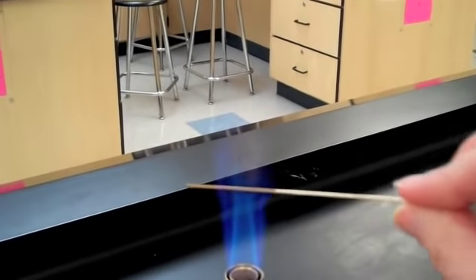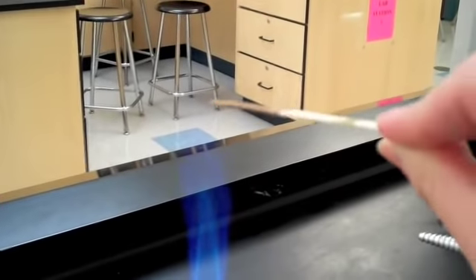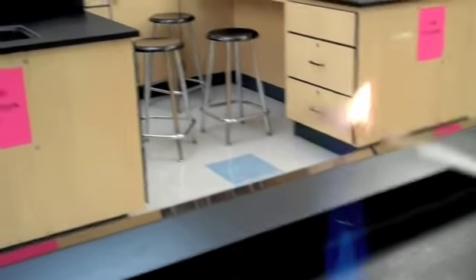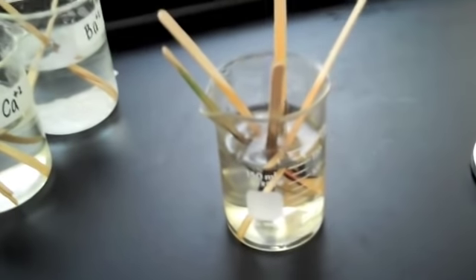The color of the iron is a little bit hard to observe, but if you look at the edge of the flame, you should see that there is an orange color coming off of our iron sample. There it is nicely. Again, we extinguish our flame that may have formed on our stick before continuing on to potassium.